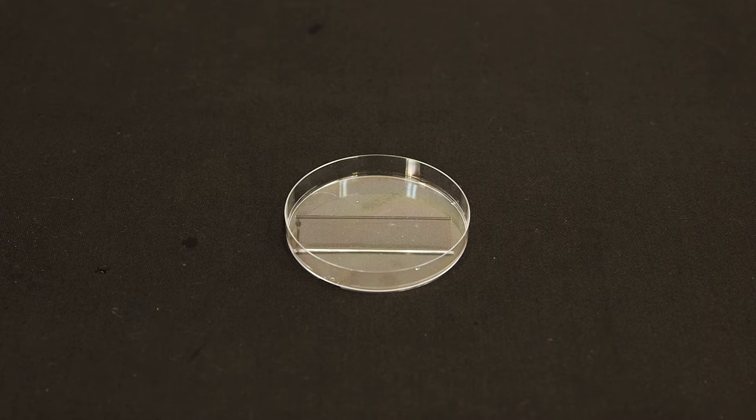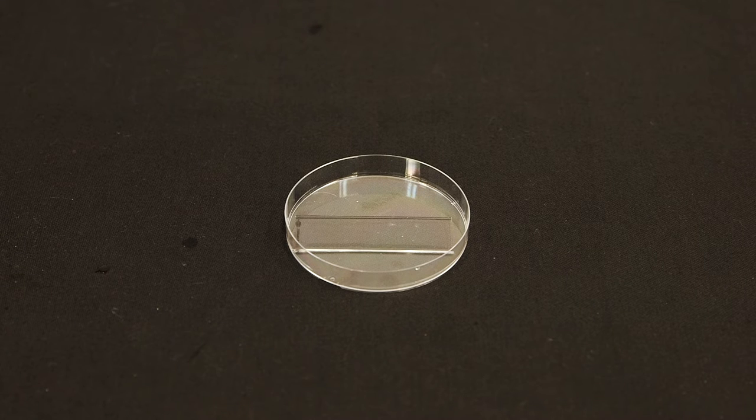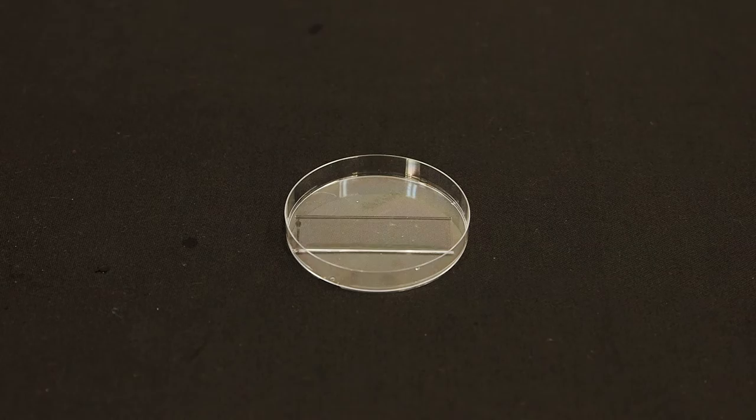The key parameters affecting chip micro-well occupancy are cell concentration and settling time. Refer to your protocol for more details.